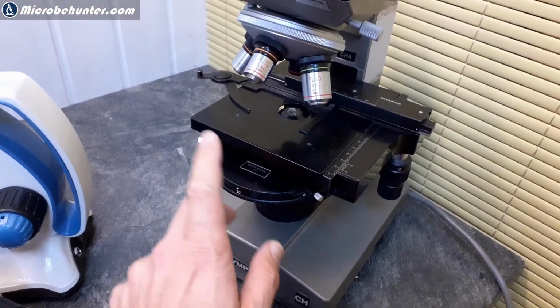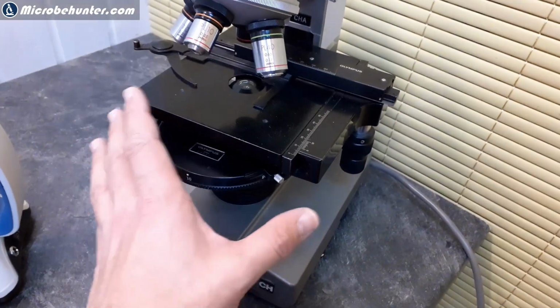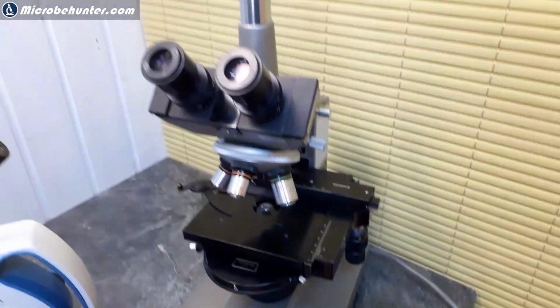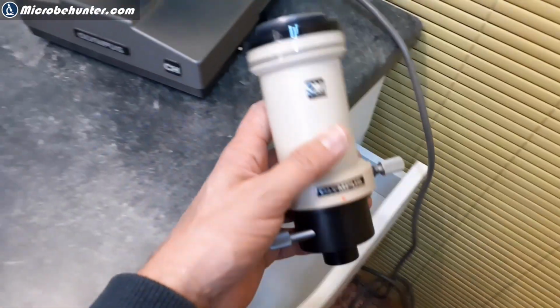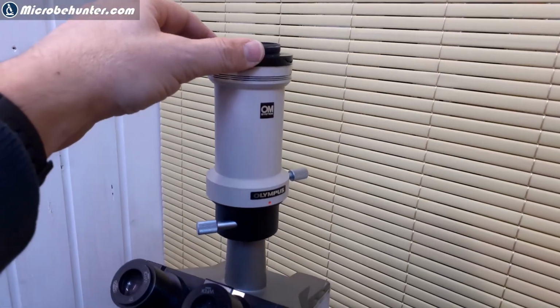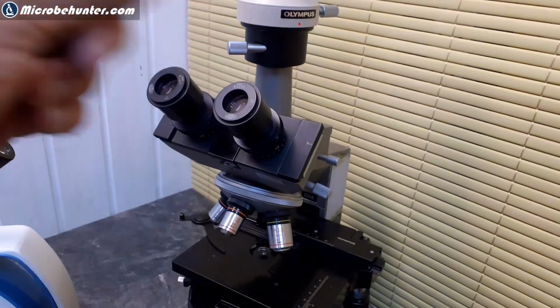And for another 300 euros, I bought phase contrast objectives and a condenser, which you cannot get otherwise, right? But for Olympus, because it's been used so much in research and education, for this reason it was available, and that's why I got additional parts and spare parts that otherwise would not have been possible. Just want to show you here my drawer. This is, for example, a dedicated Olympus camera adapter that goes up here on top, and then I can connect a DSLR camera. Gives me excellent quality. That's possible because the company designed everything as a set.